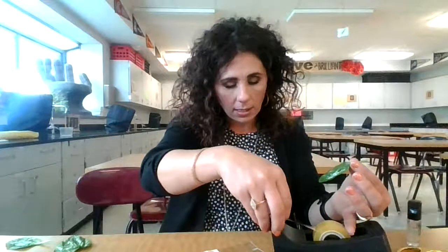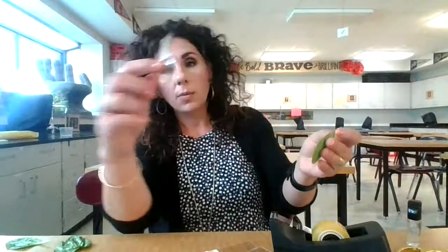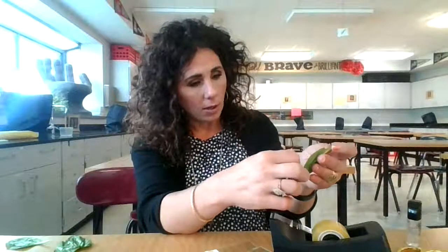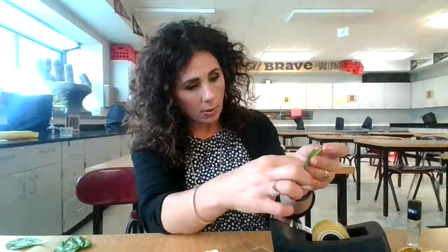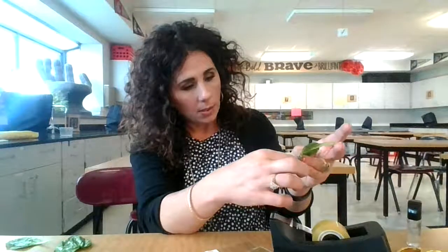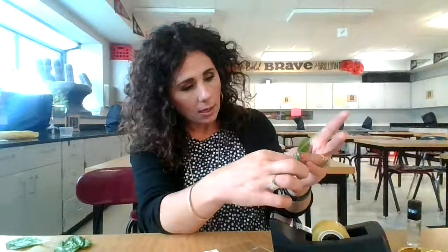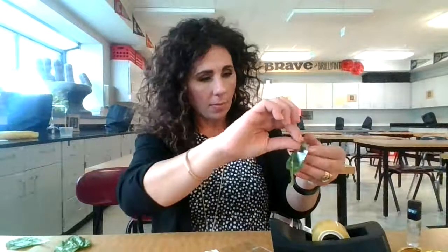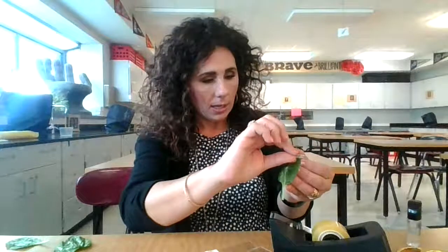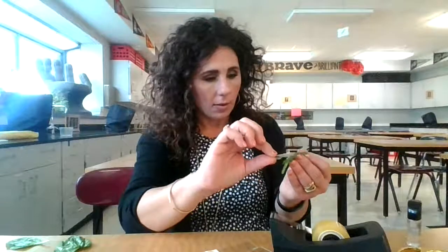It's really important when you do this that you keep your fingers and fingerprints as far away from all of this as possible. When I do this, I'll make sure the top part of the tape — away from my finger — is where I actually press the leaf the most to pull off that skin layer, so that the part my finger is touching is not going to be part of what I'm looking at under the microscope.